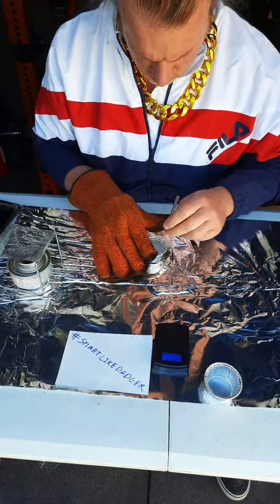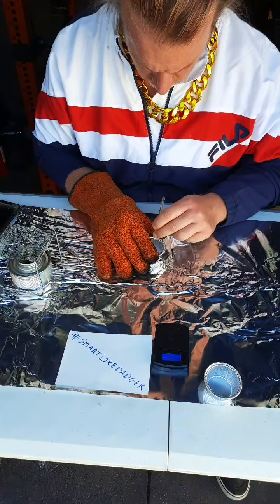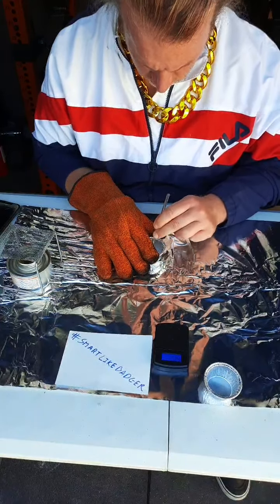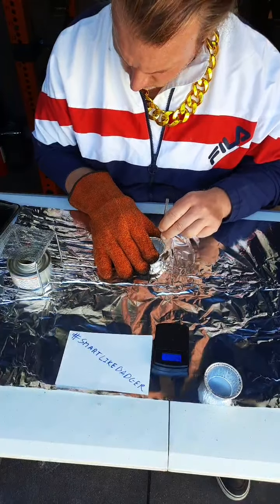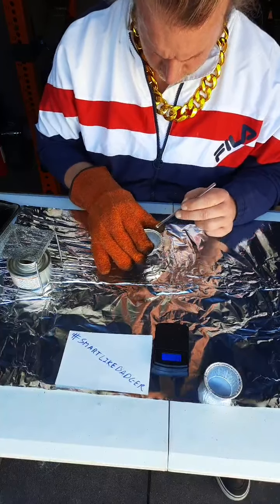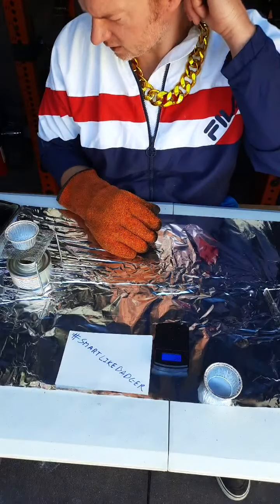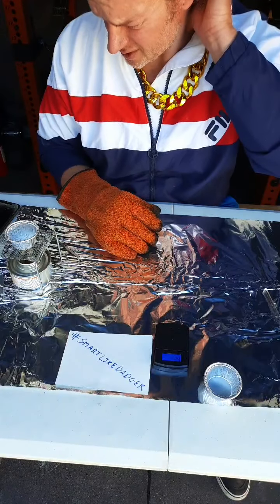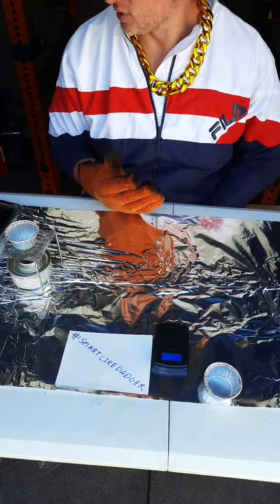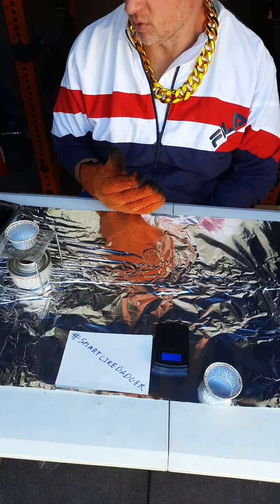This looks very much the same. Ooh, it's more brittle, meaning it's easier to crush. We'll just let that go for another 30 seconds. And let's not forget Boris's little mistake, that this number will be artificially low. We will heat for another minute, do a second heating.